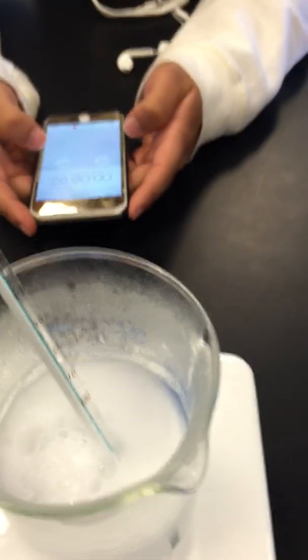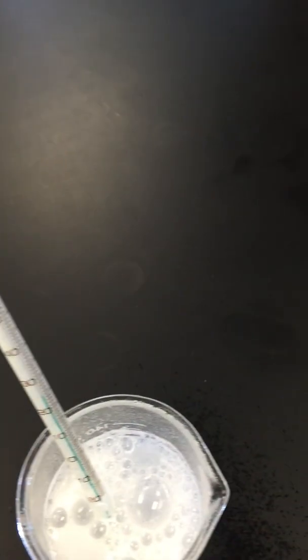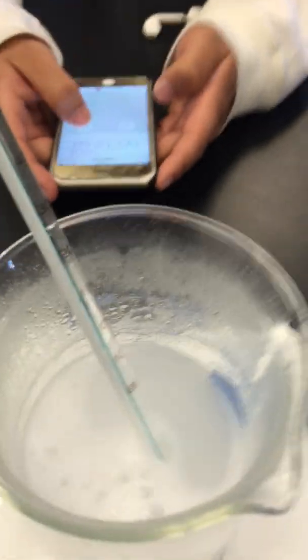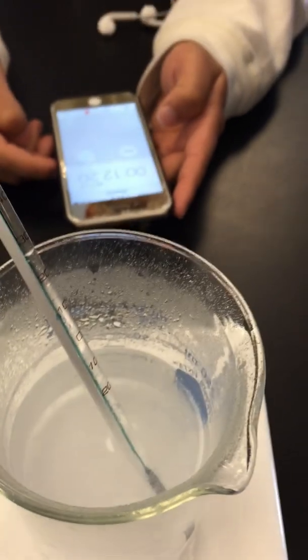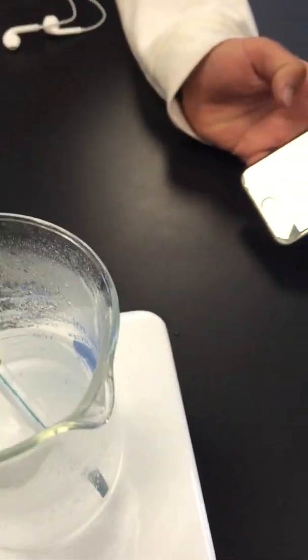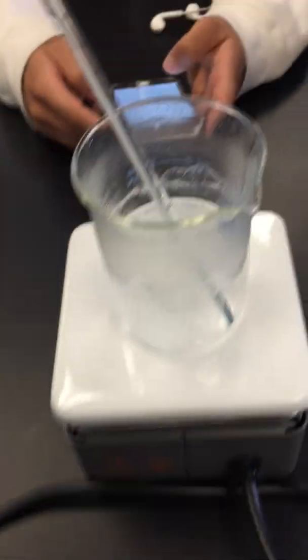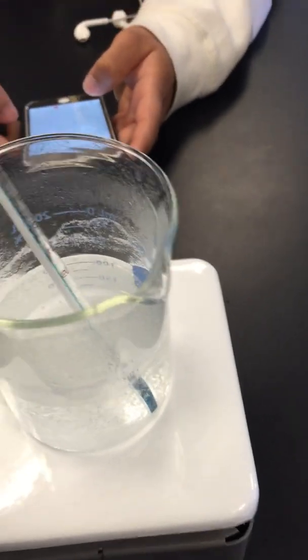All right, so now we got two reactions - the hot water reaction, the cold water reaction - and we're timing both. Gregory, what do we have for the cold water reaction? How much? 27 seconds. This one I think it's already over. Oh my god, is it done? Yeah. And how many seconds do you have? Only 12 seconds. So look, we have different times for different reactions because of the different water temperature.